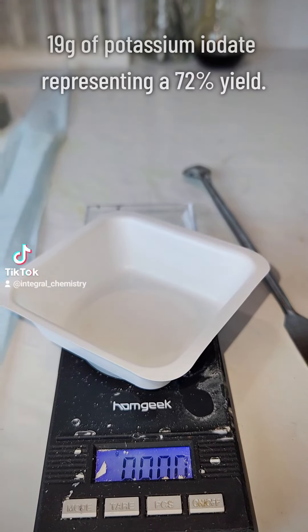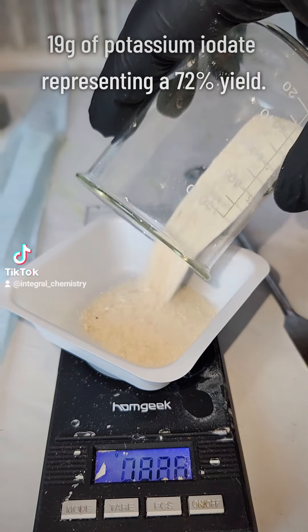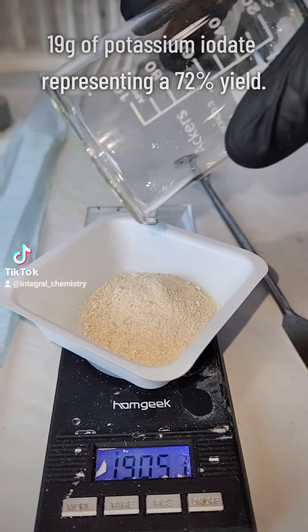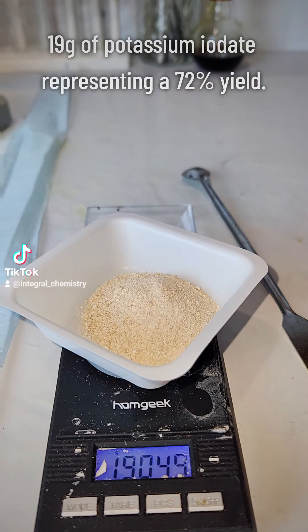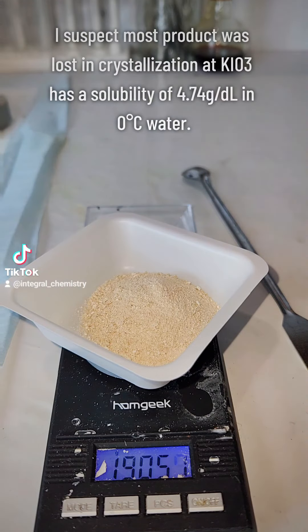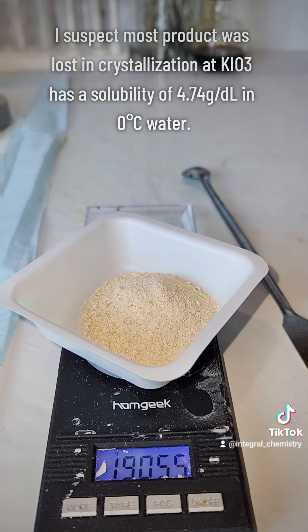These crystals were scraped out, washed, and vacuum desiccated, and my final yield is 19 grams of potassium iodate, which represents a 72% yield.